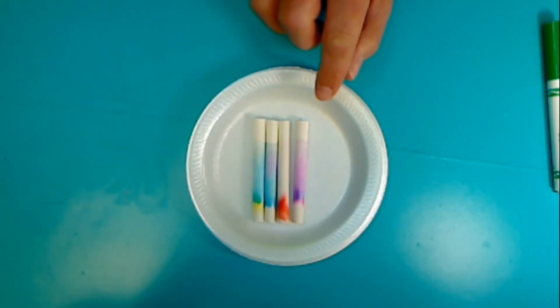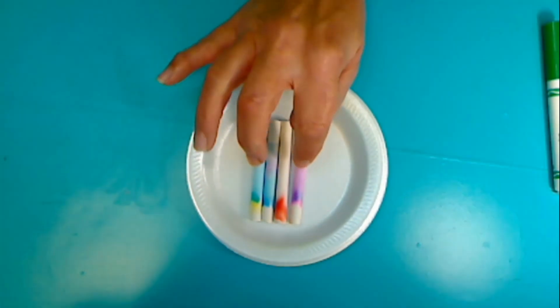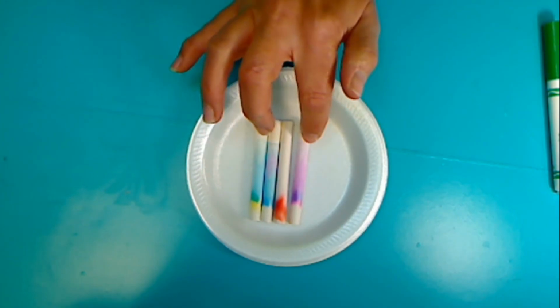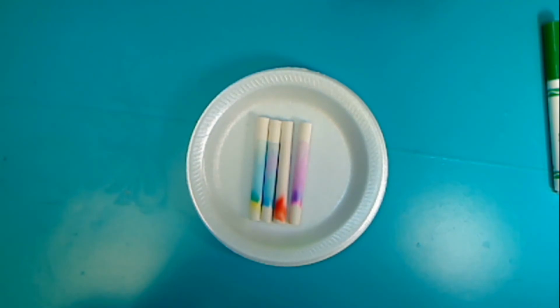So here are the results that I got. As you can see, water moved up the chalk, and so did the colors, but it's not just the color purple that we are seeing. So let's talk about what happened. We may think when we see the color purple that that is all we are seeing, that there's just purple dye in here, but there are different pigments that make up purple. Do you remember what 2 colors you can mix together to get purple? It would be red and blue.